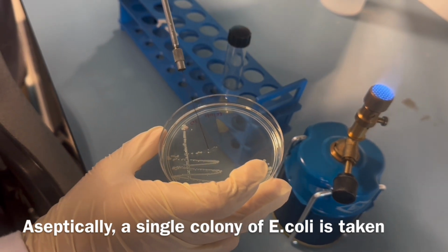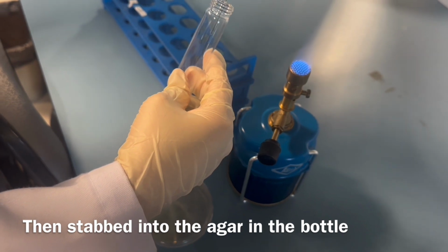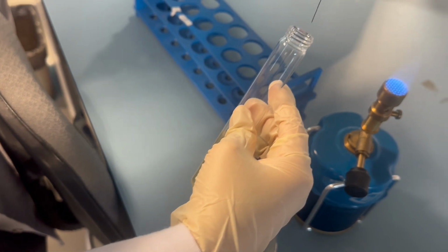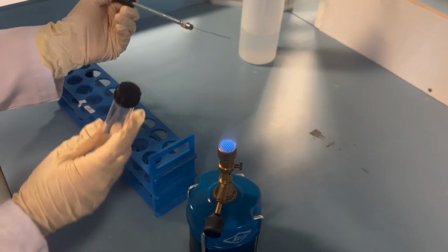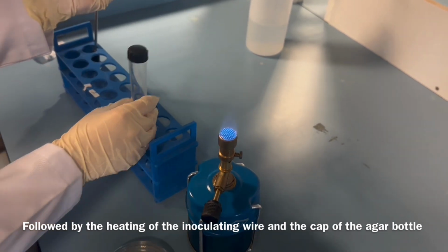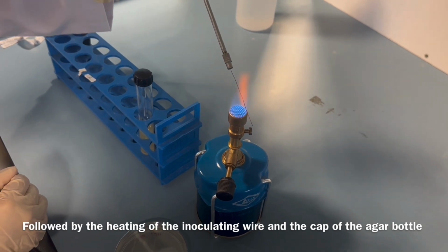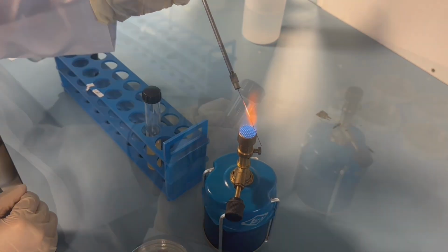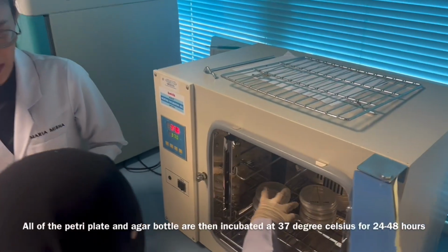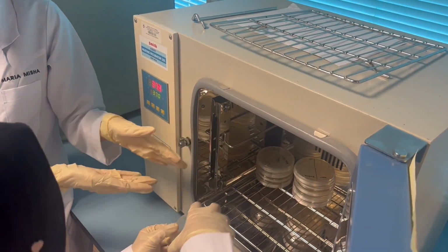So aseptically, a single colony of E. coli is taken, then stabbed into the agar in the bottle. Followed by the heating of the inoculating wire and the cap of the agar bottle to remove any contamination, so that we can get the result precisely. Finally, the agar bottle is labeled. So here, all of the Petri plates and agar bottles are then incubated. When it's heated, there's condensation.